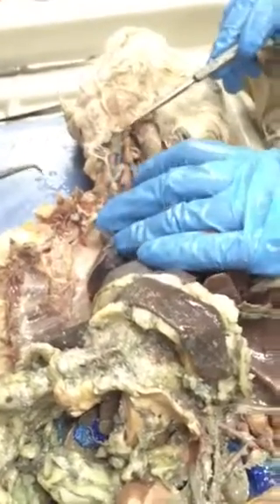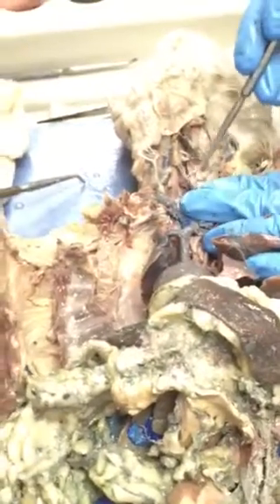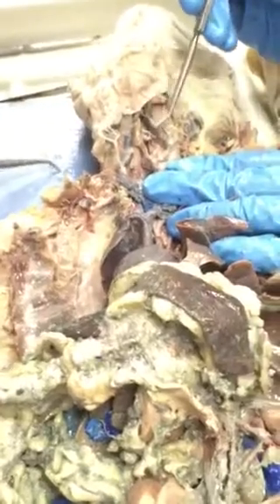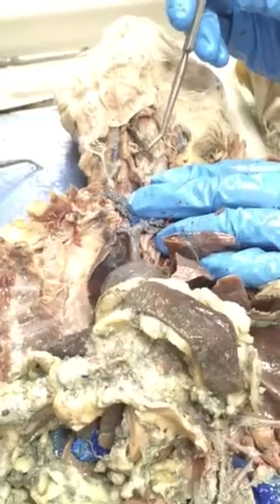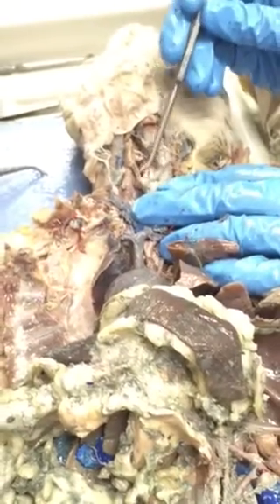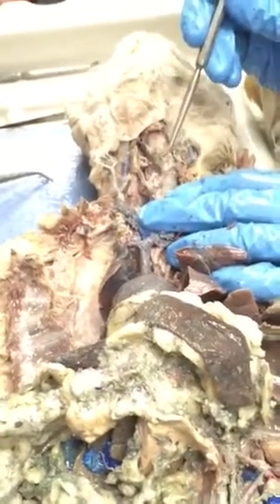Because we were trying to find it. You should only know the internal carotid artery. The internal? You mean the common? I mean the common, sorry. Okay, so don't worry about the external? Common carotid. That's right.